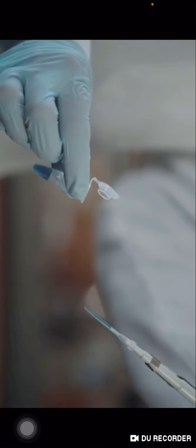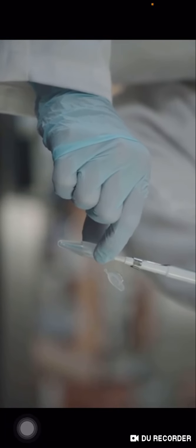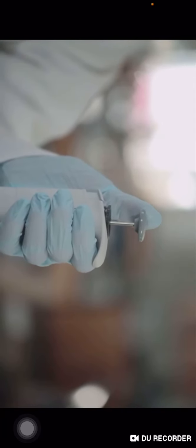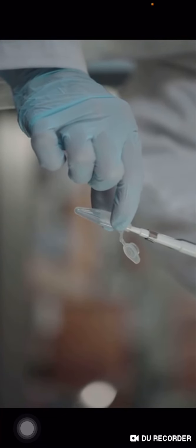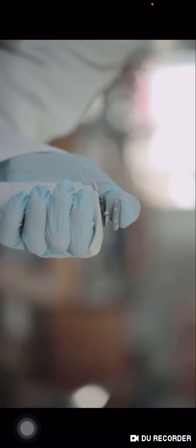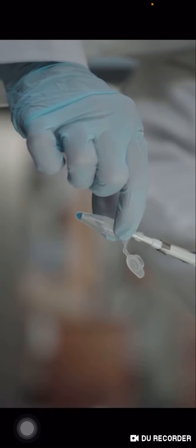Make sure that you keep the pipette tip in the fluid until the plunger has completely raised to its original position. The pipette was set for 20 microliters, so the volume of fluid taken up into the pipette tip is 20 microliters. To expel the fluid from the pipette tip, place the pipette into the tube into which you want to expel the fluid. Then slowly push the plunger. As you push down on the plunger, the fluid in the tip will be pushed out into the tube.